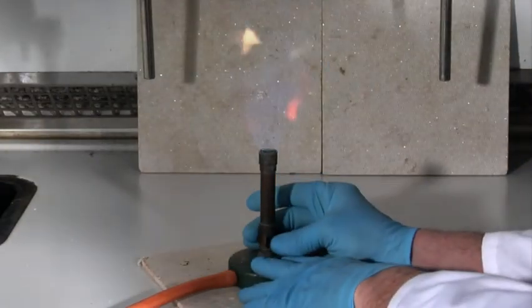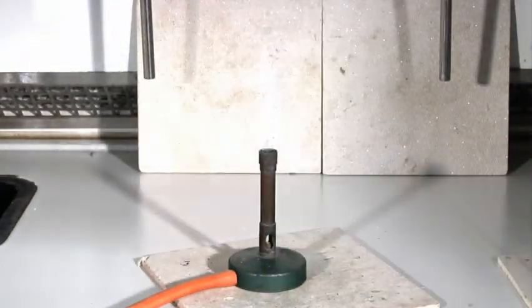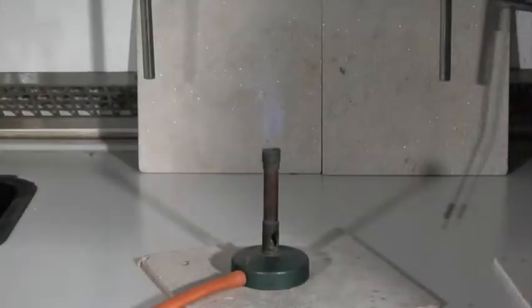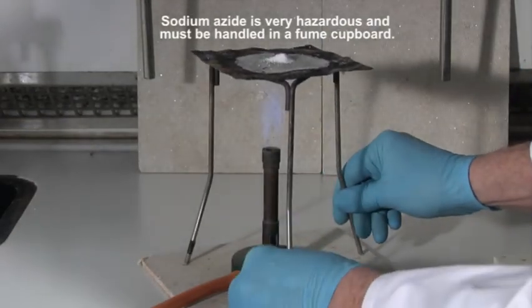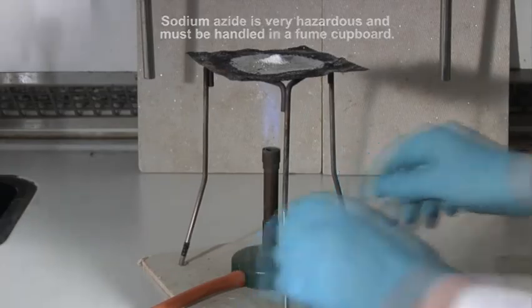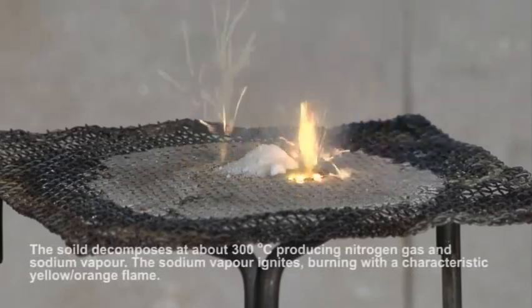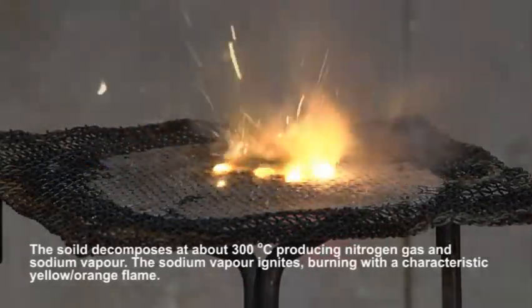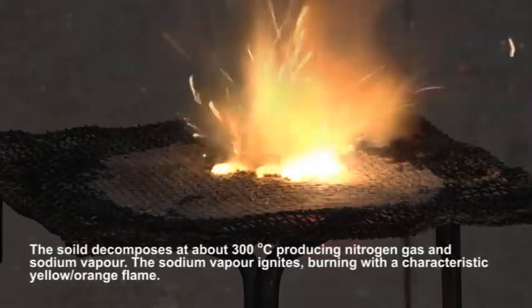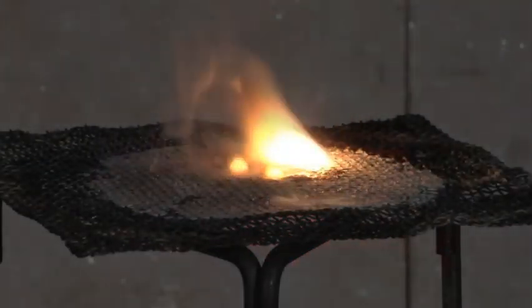Airbags protect drivers and their passengers from serious injury during an impact. The key compound in airbags is sodium azide. When this compound decomposes, sodium vapour and nitrogen gas is formed. Clearly this compound alone cannot be used in an airbag — it is too hazardous.